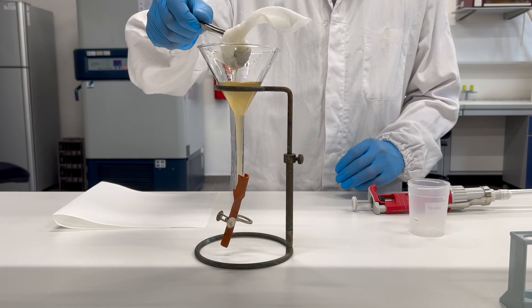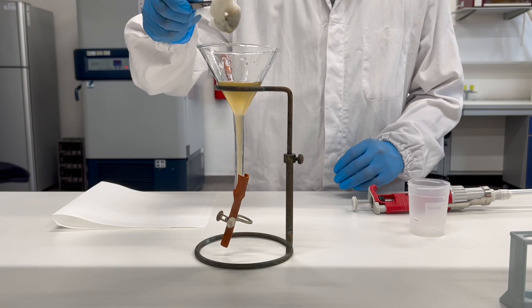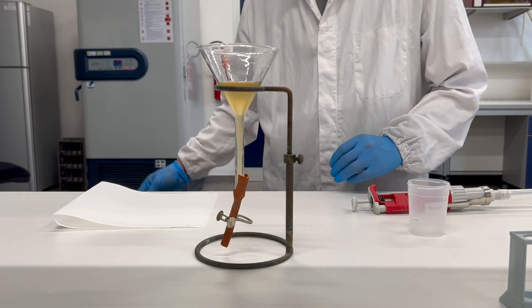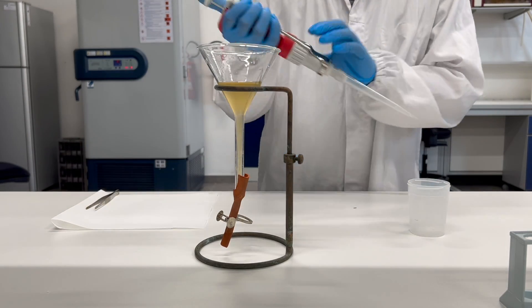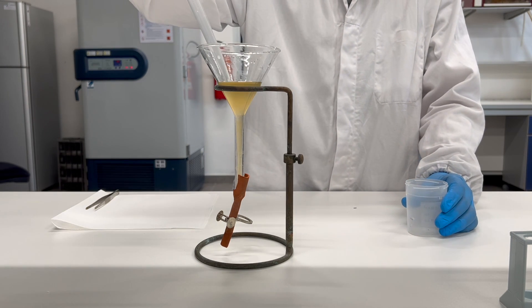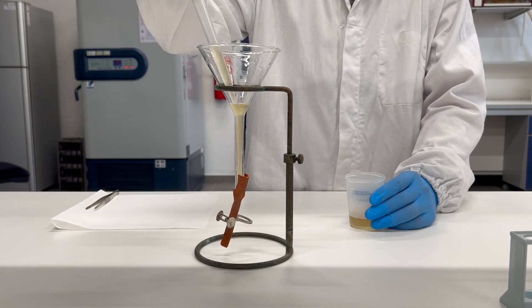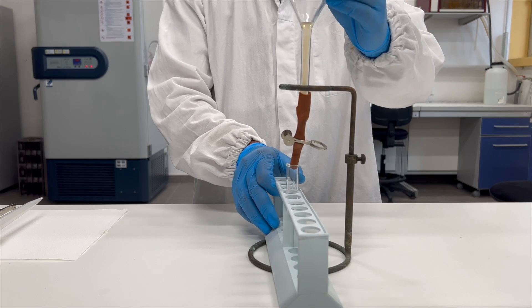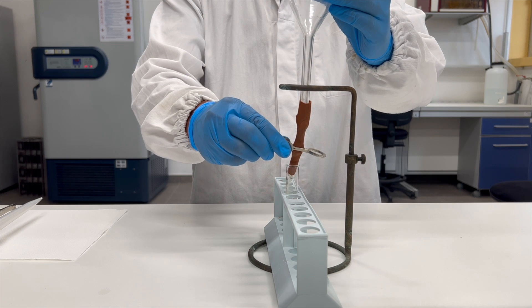After 12 hours, remove the wrapped feces from the funnel and aspirate the supernatant with a transfer pipette, being careful to only leave a small amount of liquid contained in the narrow bottom portion of the funnel. Transfer the remaining liquid into a centrifuge tube and centrifuge at 2000 RPM for 10 minutes.